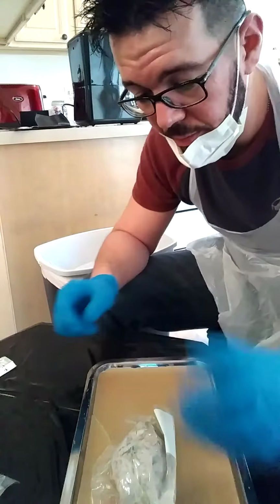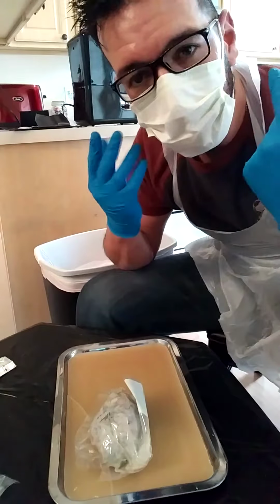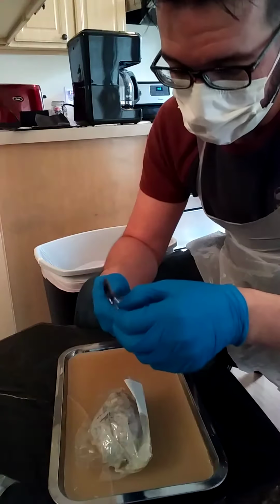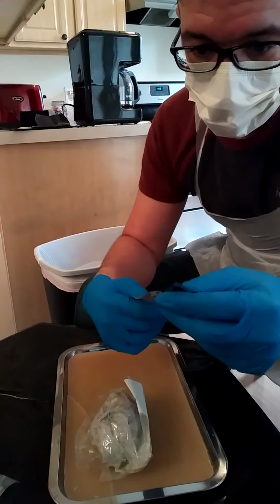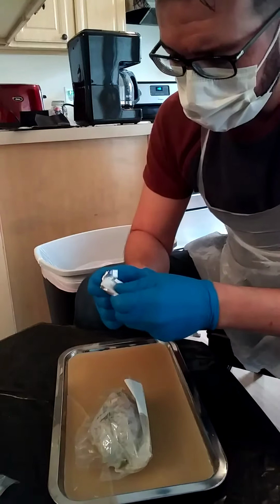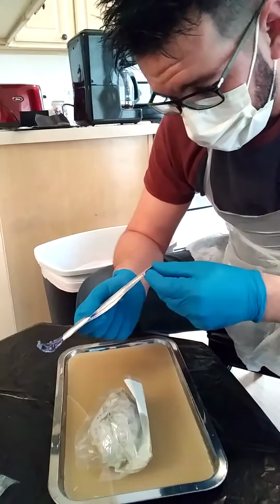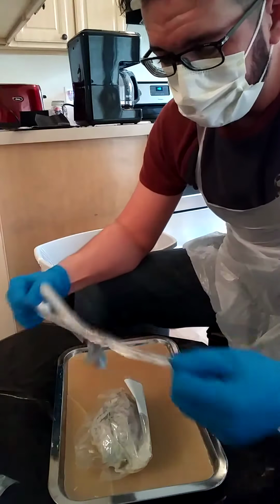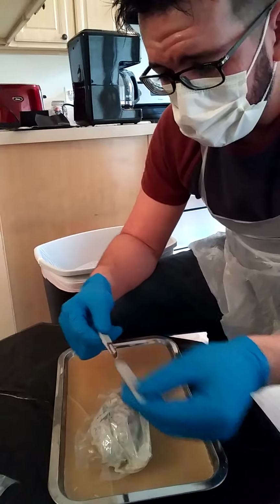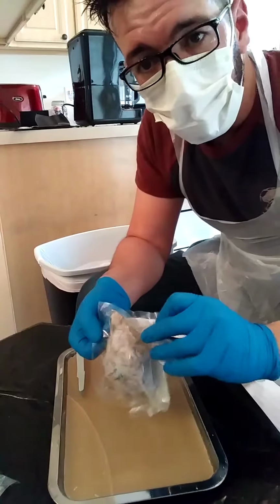Let's get started. I've got my pen, the sheep brain, and my PPE, as you can see. I have the scalpel. Can't wait to see how this works. Let's hop to it. Okay, put that here for now. We're not going to use it for a little bit anyway. So, sheep brain, woohoo!